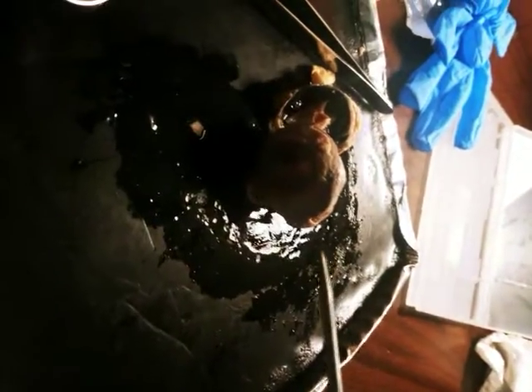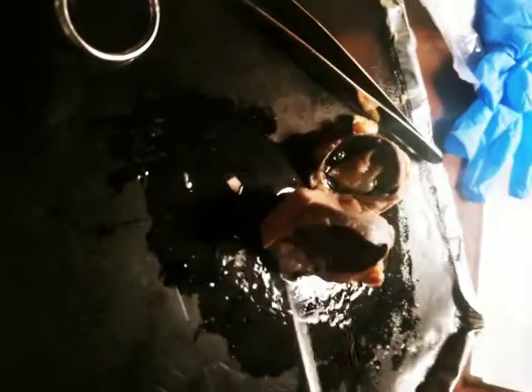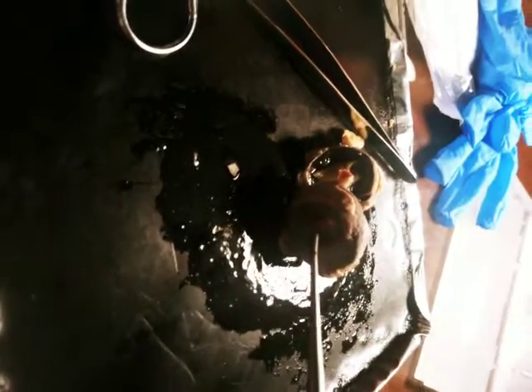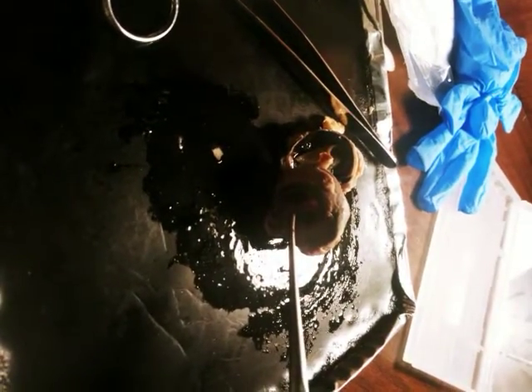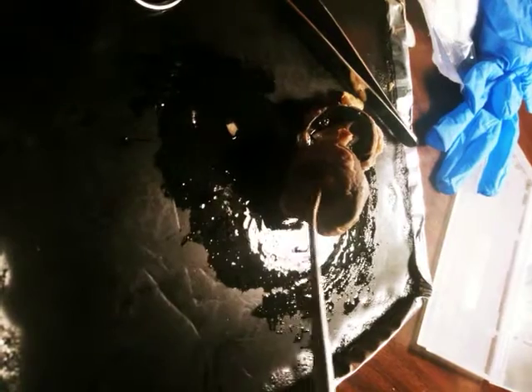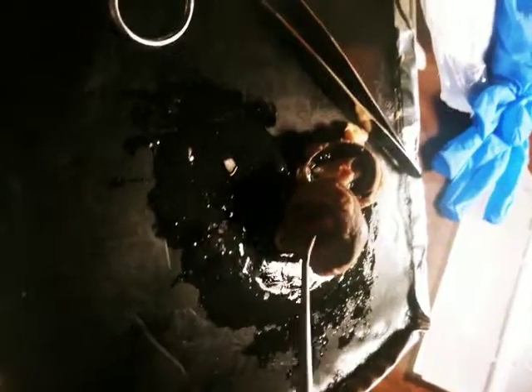The aqueous humor is the stuff that was leaking out from up here. And through the pupil is where the light enters the eye. And the cornea is transparent, covering, allowing light to enter the eye. The cornea is cloudy. This is so hard to see, I'm sorry.